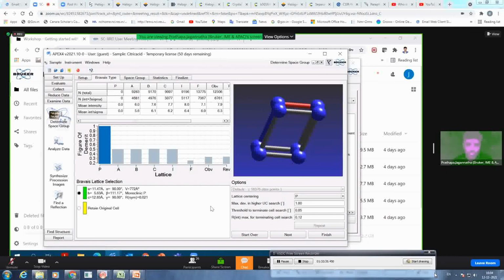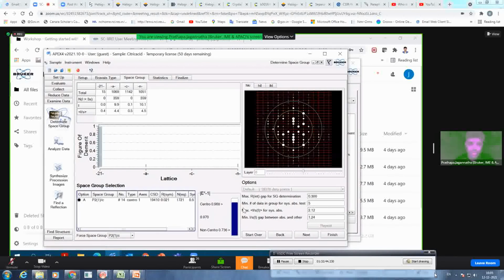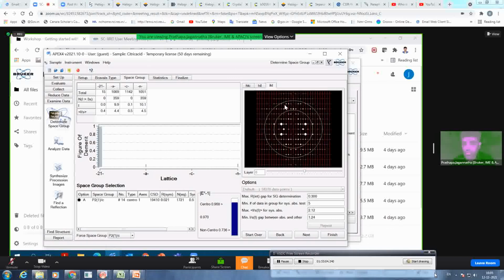And based on that, if you want to reduce and see whether it is triclinic, that is also possible, so you can reduce this threshold and do it as well. But to save time, I just quickly move to the next. Now it is telling P21/c is the space group. And then you have an option to force any space group from the 230 possible space groups. And then there are some informatory planes, showing how the reflections are represented or seen in your different planes. You can watch here. It's just for educative purposes.